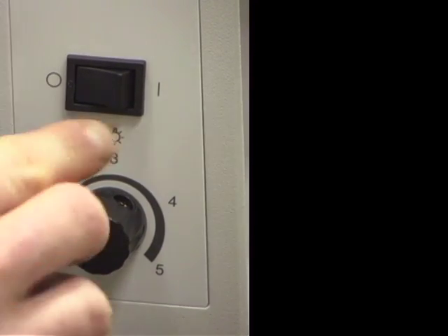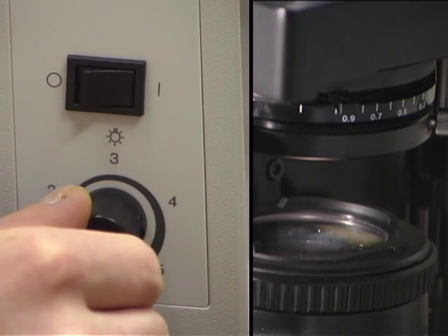If your microscope has an internal lamp, it is usually turned on and off with a sliding lever or a rotating knob.